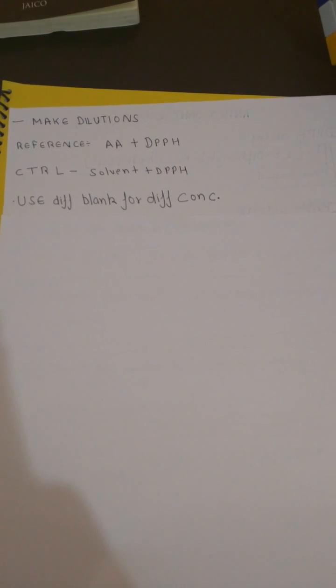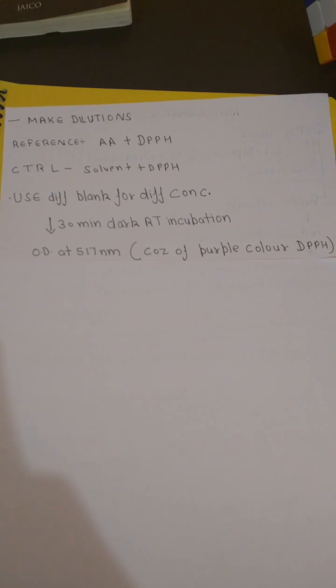Make sure to use different blank for different concentration because your plant extract will also be giving OD. After that, keep it for 30 minutes in dark under room temperature, and finally take OD at 517 nanometer.